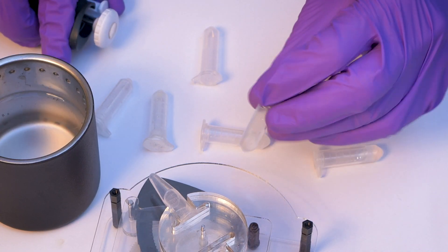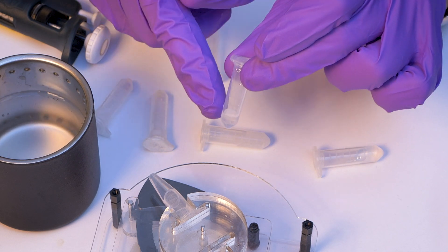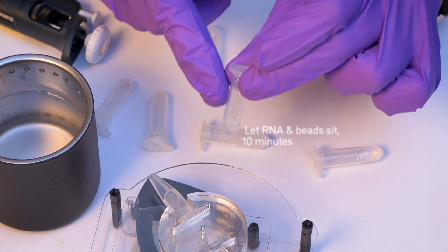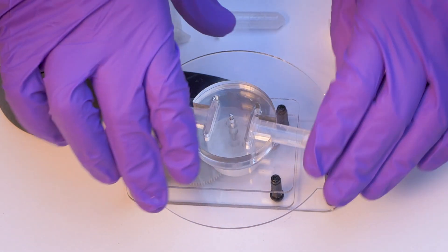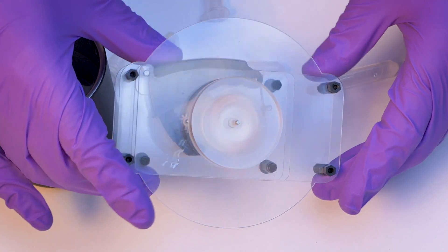So now that we've added the glass beads into the solution that has the RNA, if present, we'll just let this sit for around 10 minutes at room temperature. So after 10 minutes, any of the viral RNA, if present, will have bound to these glass beads.